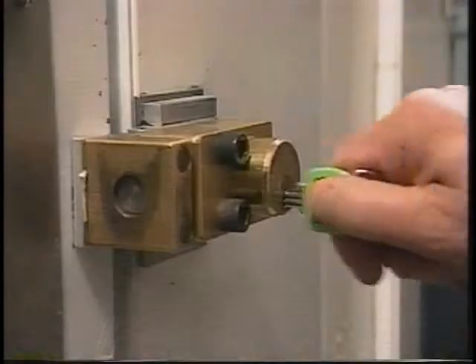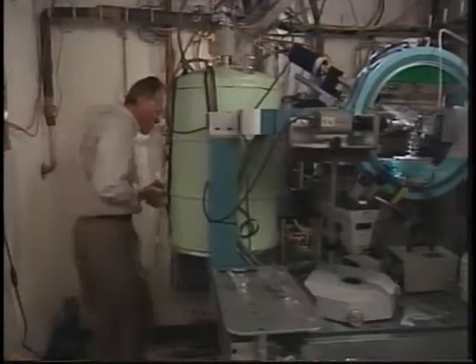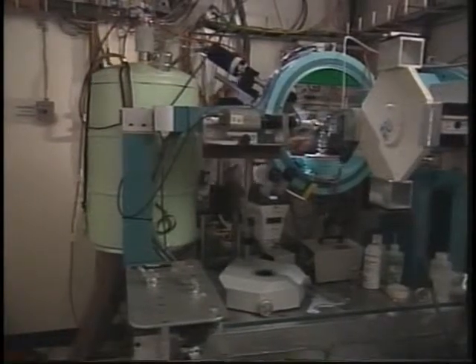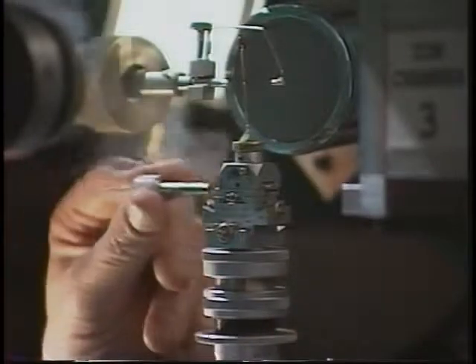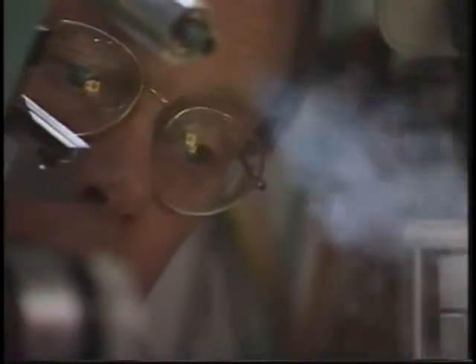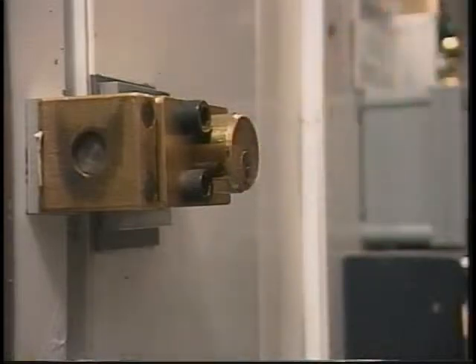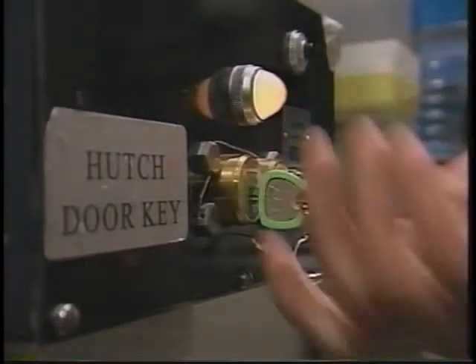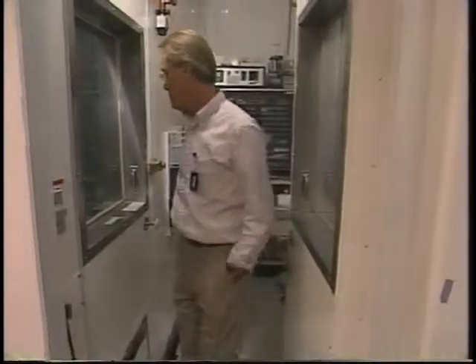The synchrotron is the newest tool available to the structural biologist. Its X-ray beam intensity can be 100 to 1,000,000 times higher than that of a home diffraction machine. Since contact with the direct beam would cause immediate serious injury, safety is built in with permanent shielding and secure interlocks. It's actually much more difficult to make a mistake at the synchrotron than it is at home. This is the consequence of having a truly dangerous beam compared to the dangerous but not as devastatingly dangerous X-ray source as we have at home.